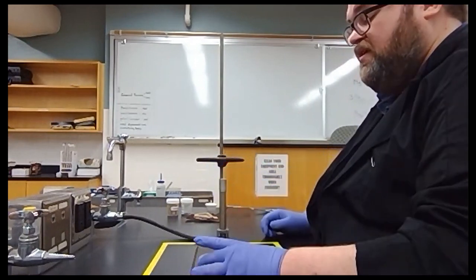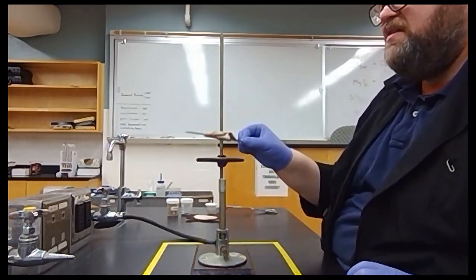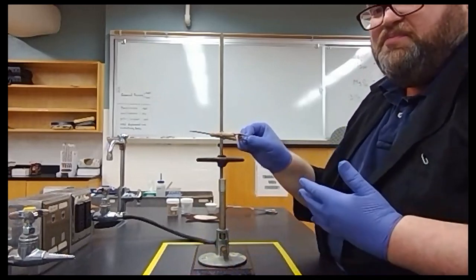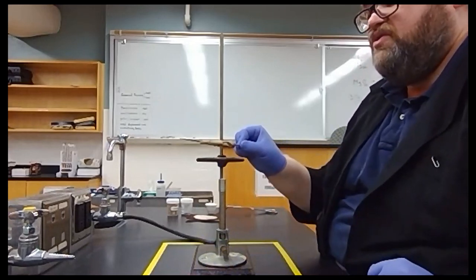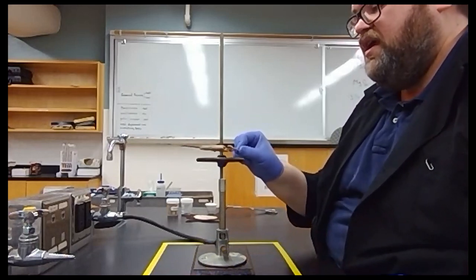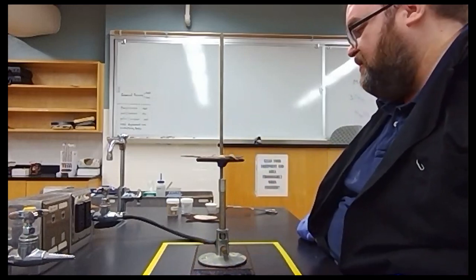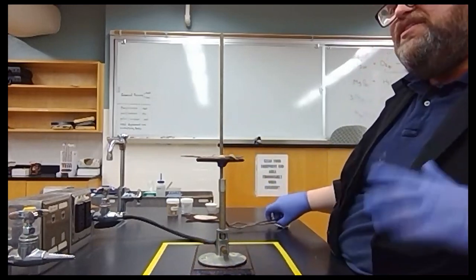Once we've done that, we can start tempering, which remember tempering means we've got a big temperature differential here. So we want to make sure that things are warm before we stick them in the very, very hot fire. We're going to temper our clay triangle then sit that down.